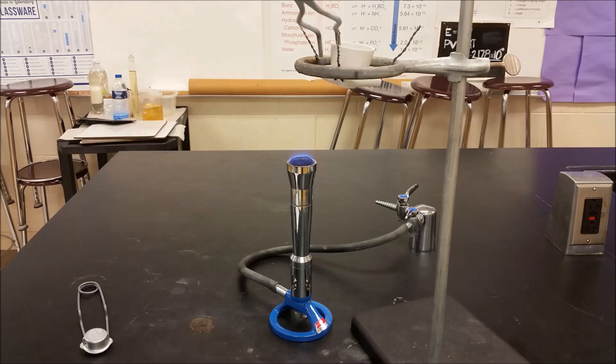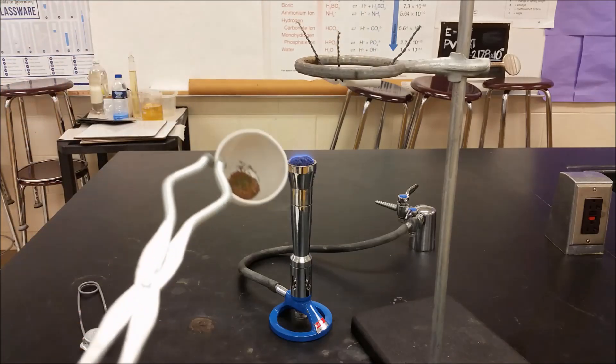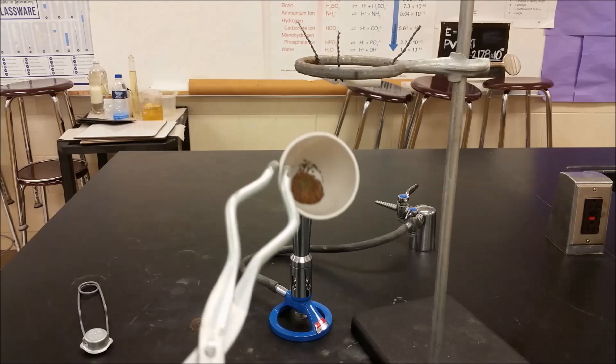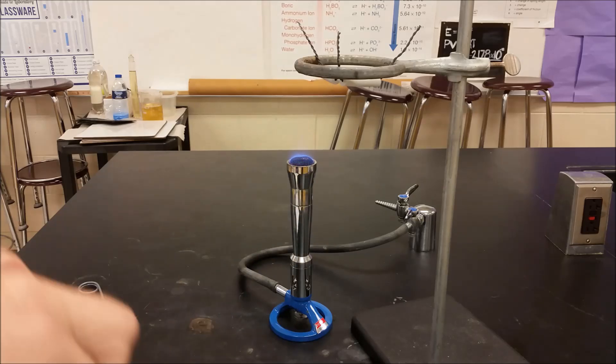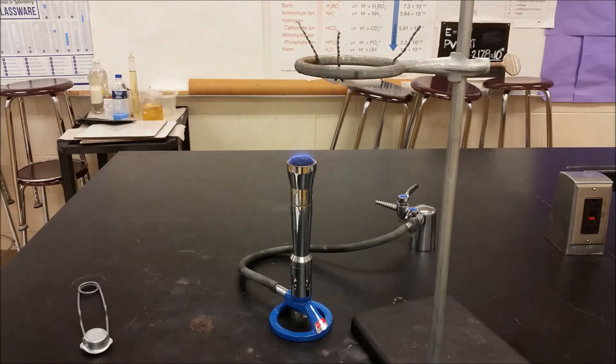So it's been heating for a little bit here. We're not done yet. Just going to show you there. We have the brown color changing from the blue-green. We're going to swirl it around a little bit. Continue heating. Try and get all of that broken up.